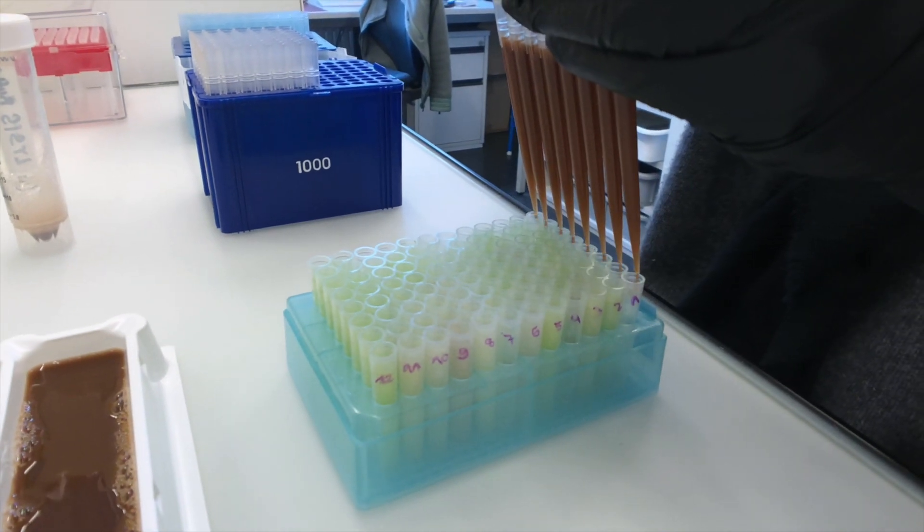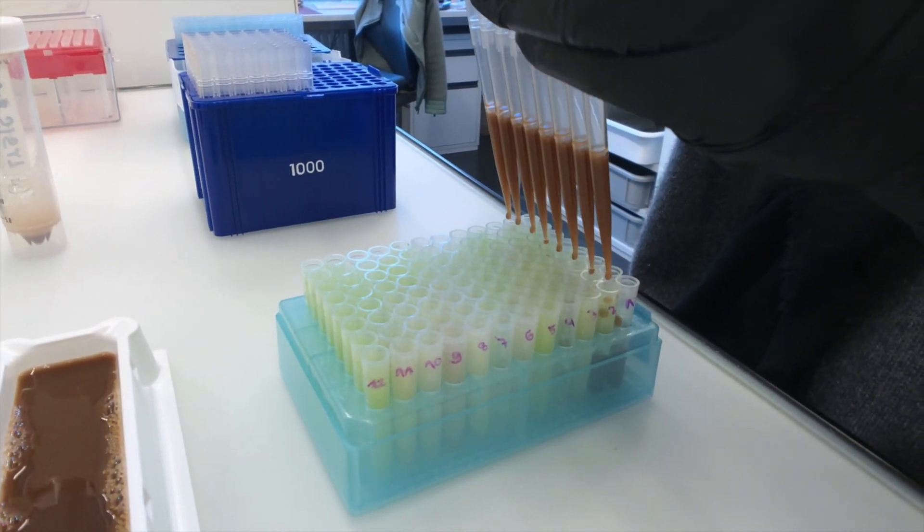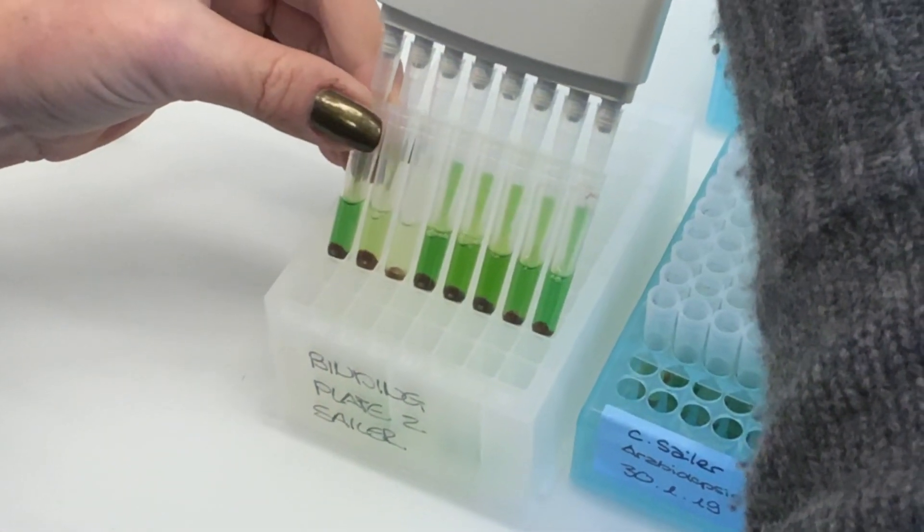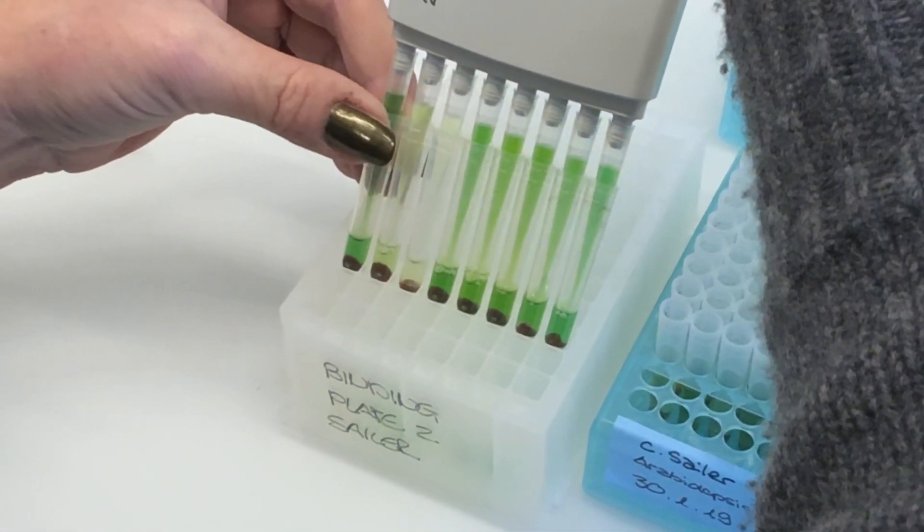We are mixing the leaf powder with chemicals and magnetic beads. Green color of the liquid comes from chlorophyll.